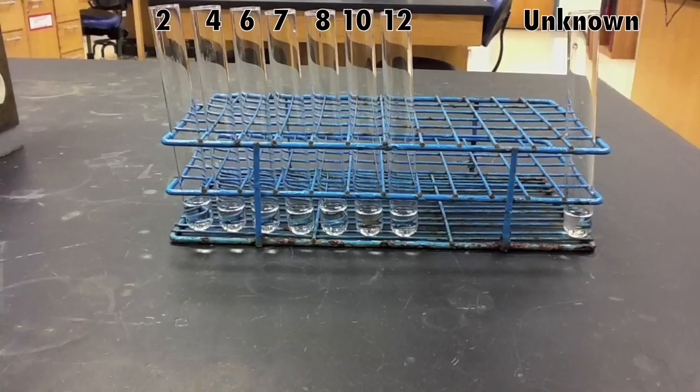On the right-hand side, I have a test tube that contains a solution of an unknown pH.